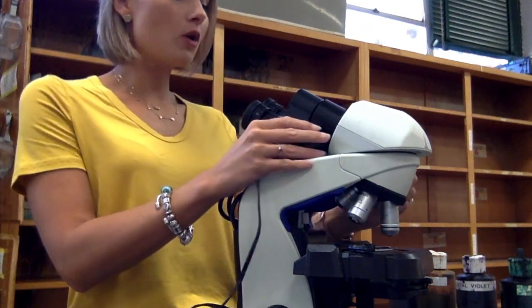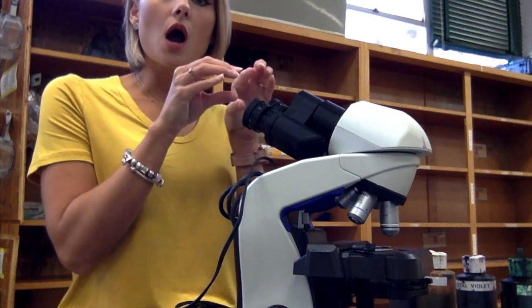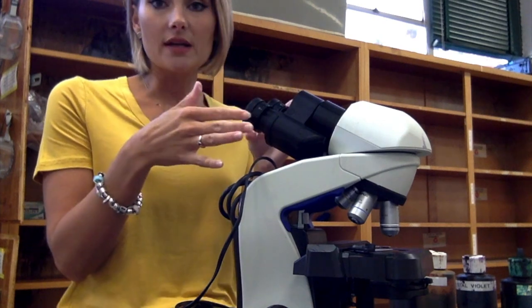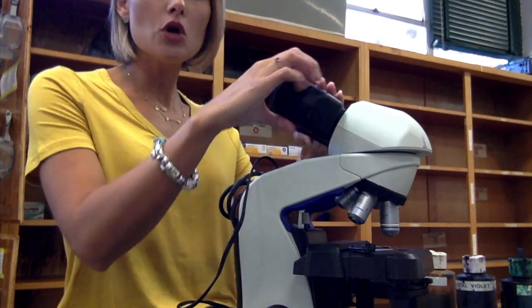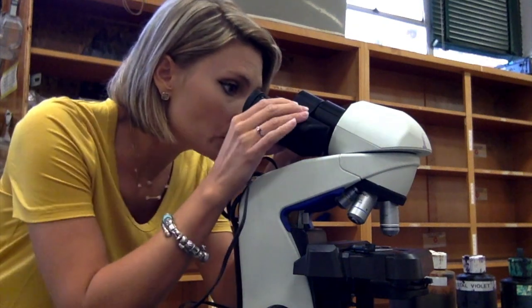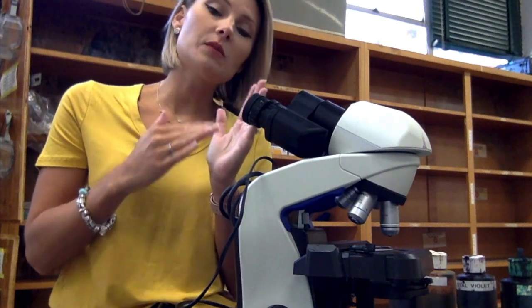First we have our ocular lenses at the top. This microscope is binocular, meaning there are two ocular lenses, which makes it a lot easier to use. These move based on the width of your eyes — you would look through and move them until you see one circle in the center. If you see one circle on either side, one will be in focus and one won't, so you want one circle in the center.